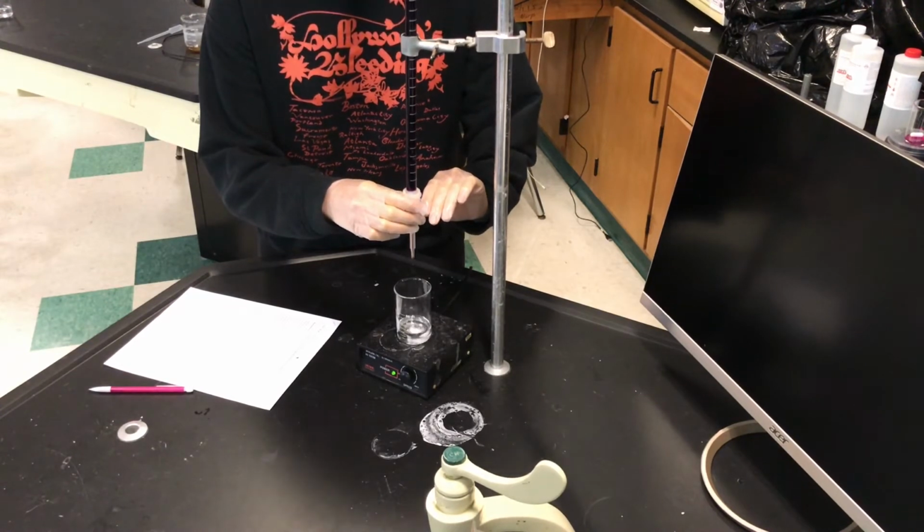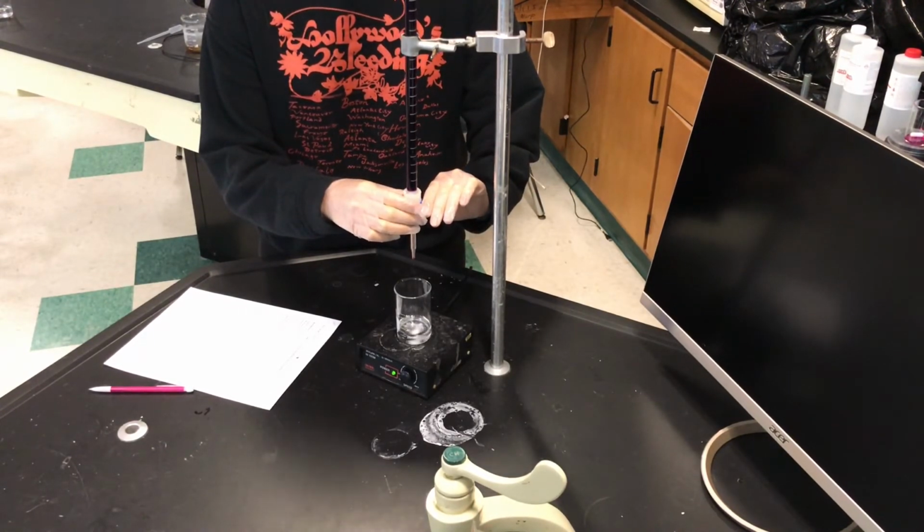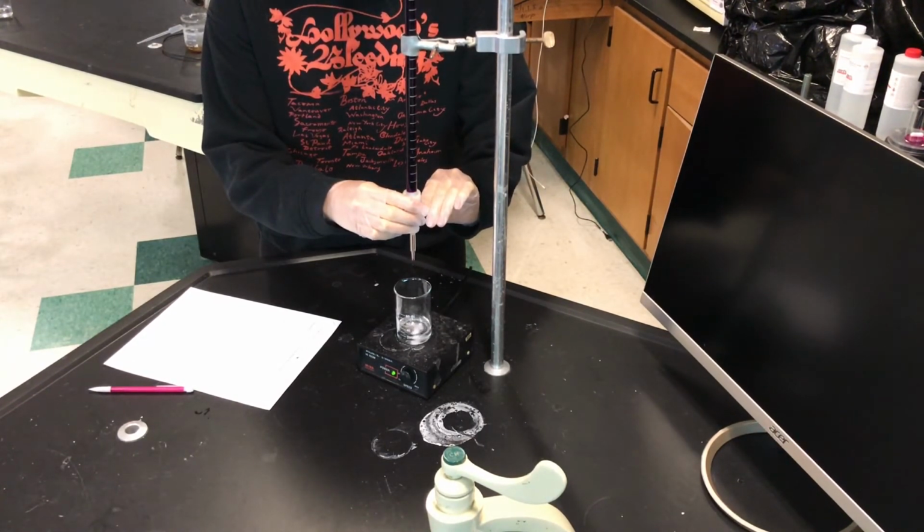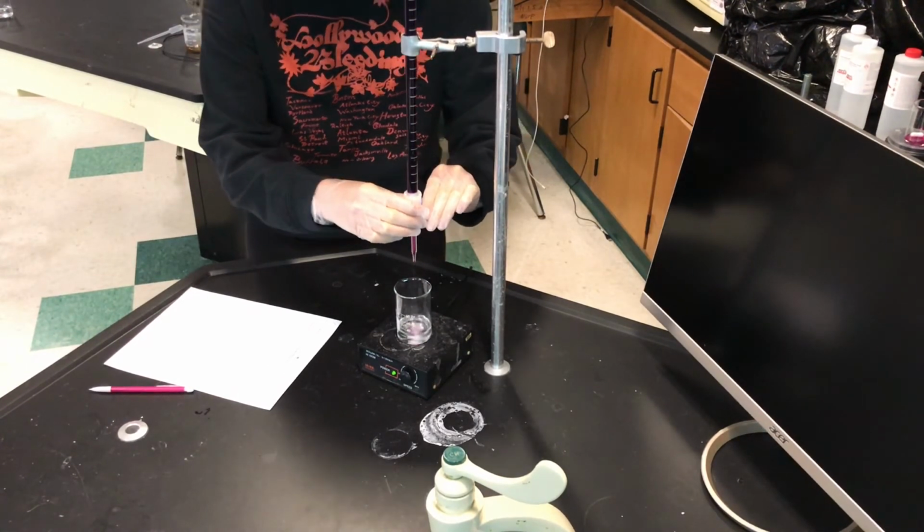So what am I doing? So now you're going to titrate. We're starting at 0. I've got to figure out how much to go down, and you know when to slow down because the color will start persisting. Where do I start? Starting at 0.